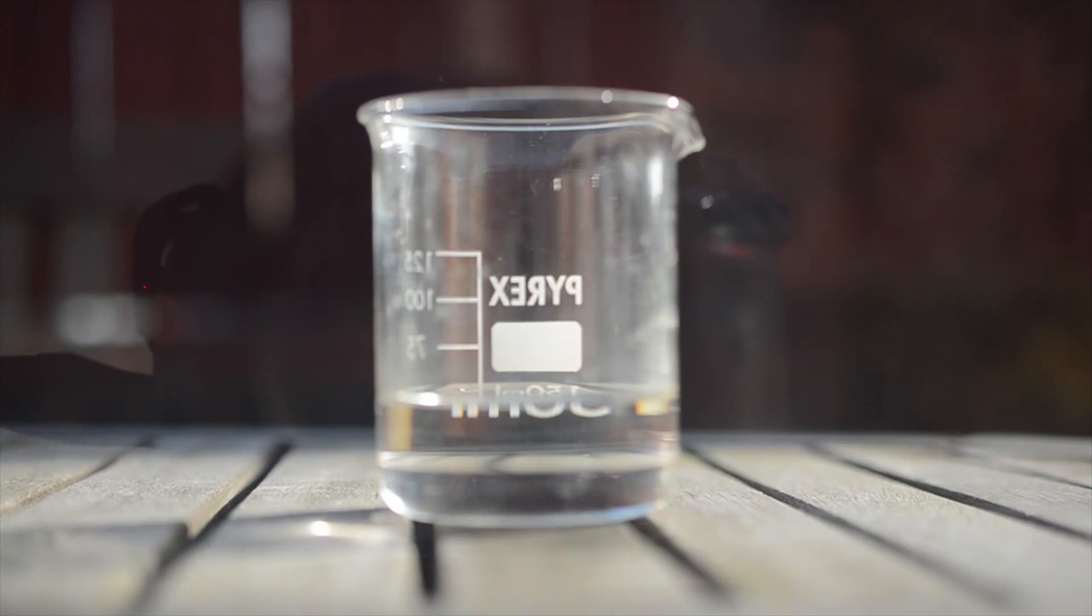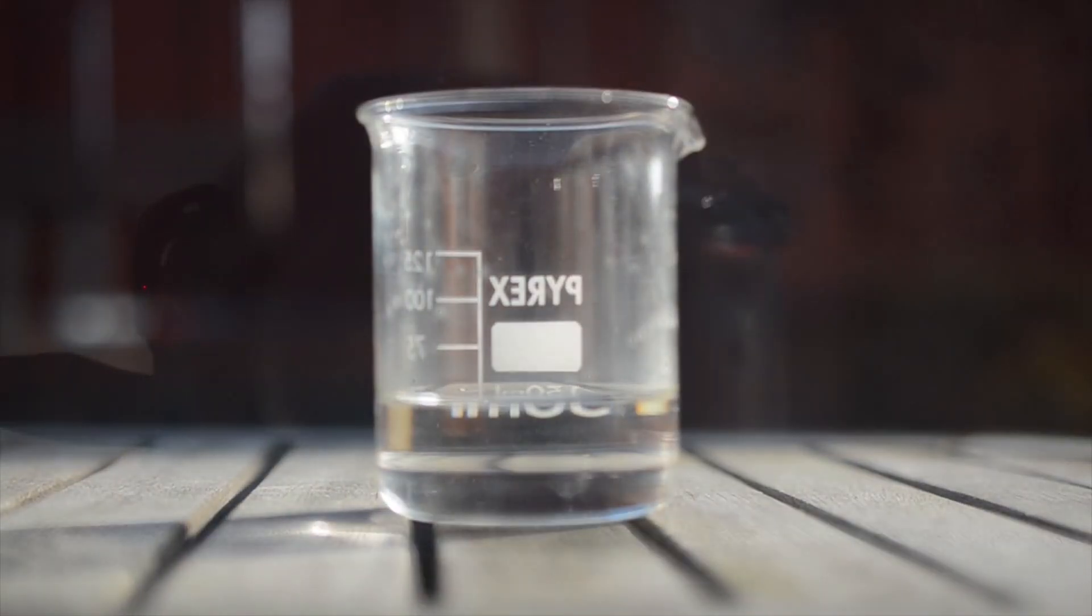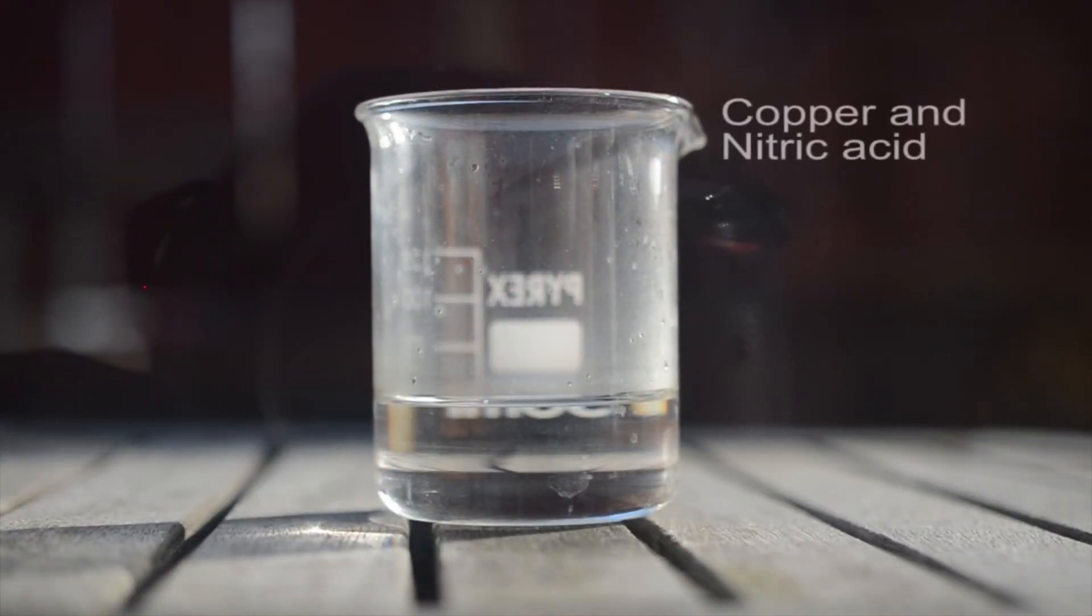It is used to manufacture inks, dyes, fertilizer, plastics, polymers, and explosives. For the first test we will see how the nitric acid reacts with copper.